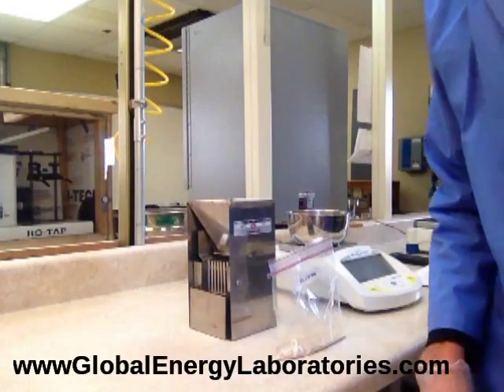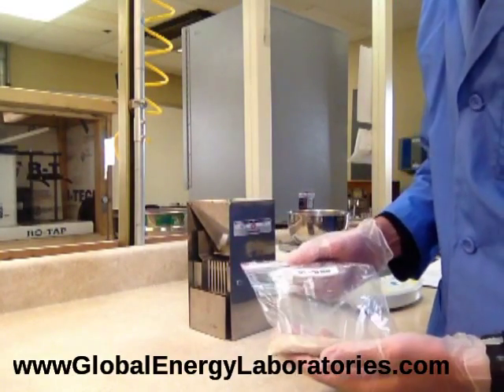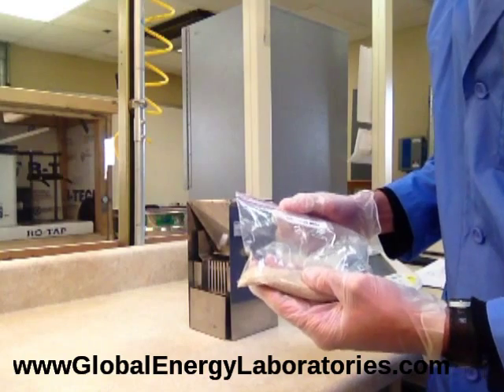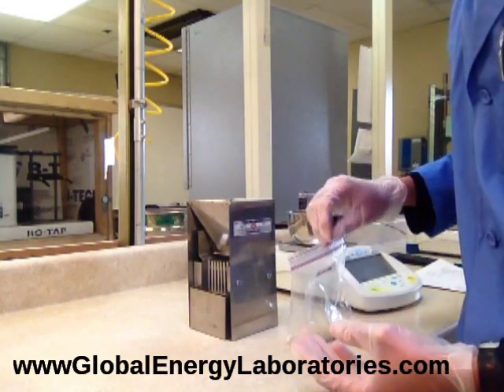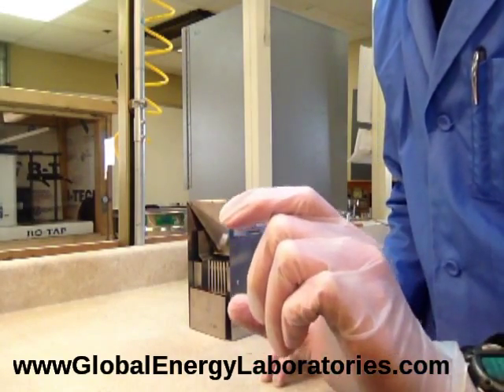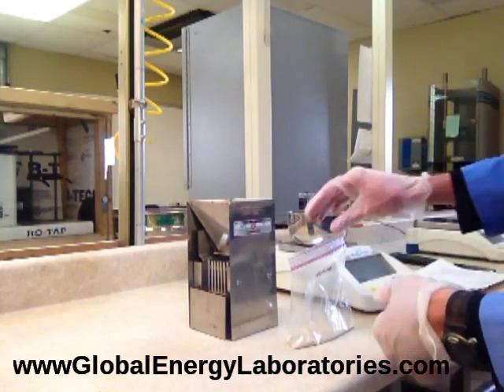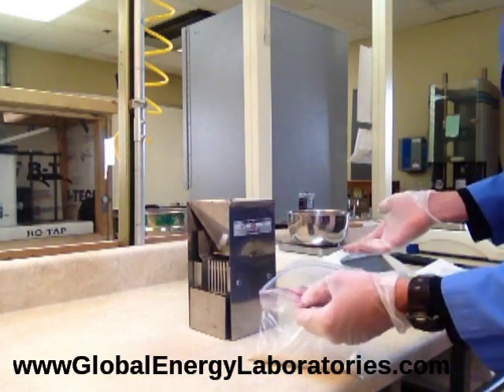So what we're going to do first is weigh out a sample, and the mass of the sample is based on the bulk density test that we did prior to this. You run some calculations to get an exact volume of sand in the crush cylinder. So first thing we do now is we're going to weigh that exact mass of sand on our scale here.